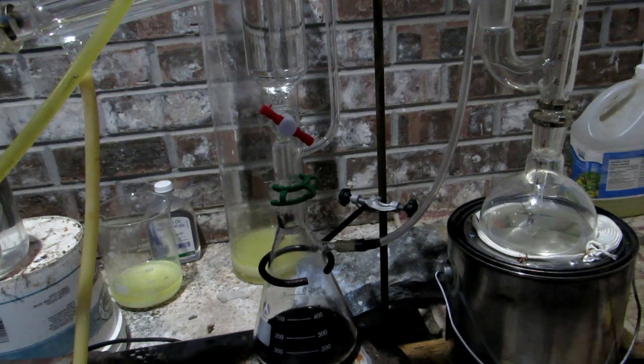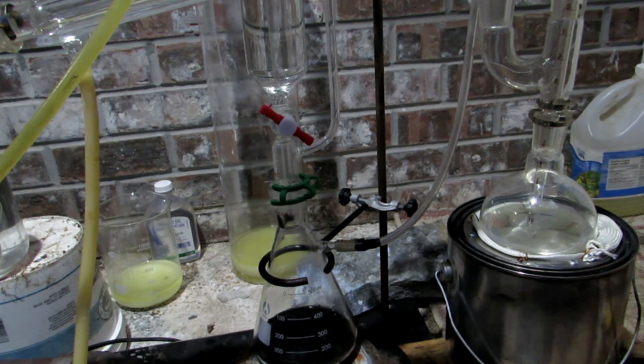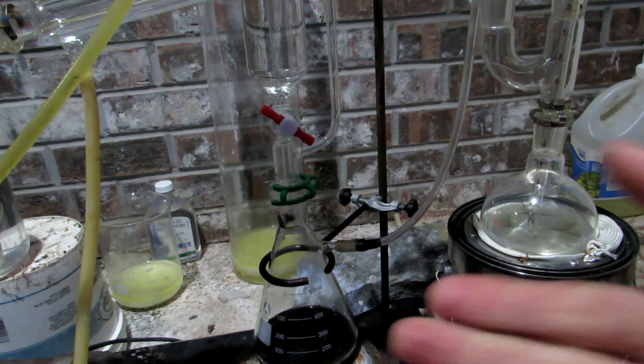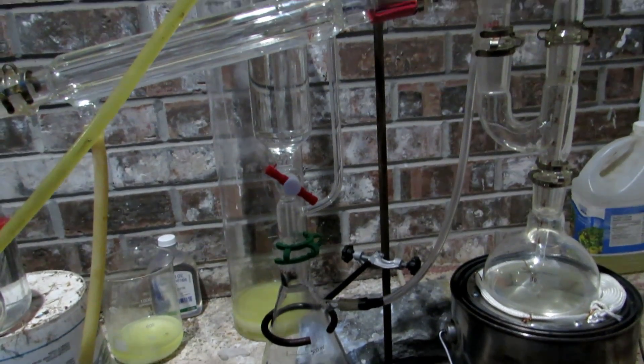Okay so as I kind of suspected the addition directly to the manganese dioxide isn't producing a whole lot of chlorine gas. There is evident bubbling but it's not very fast. So I've turned on the heat and we'll slowly heat this. This is why I had it set up on my hot plate so we could do that and hopefully that'll kickstart the reaction.